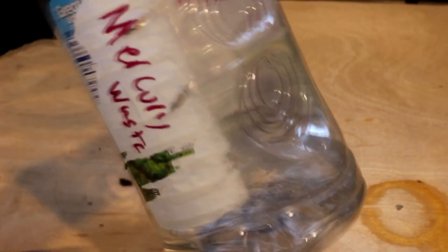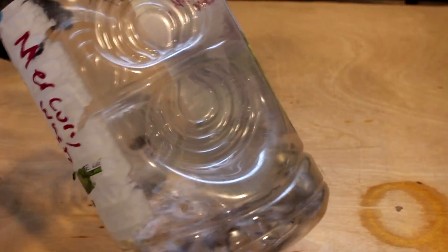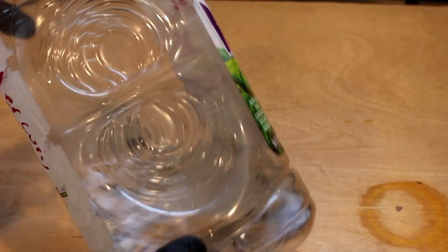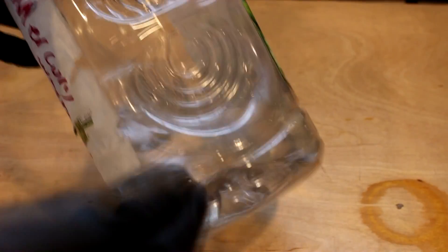This is some mercury nitrate which is dissolved in water, incredibly toxic, and I really don't have a use for it. So I'll be converting it into less toxic mercury metal.